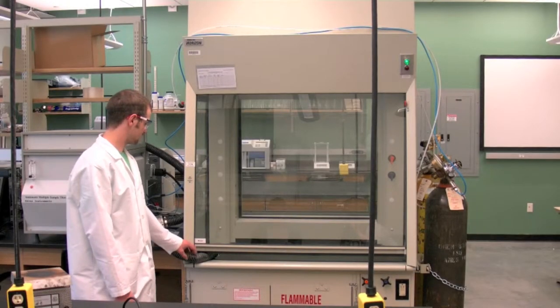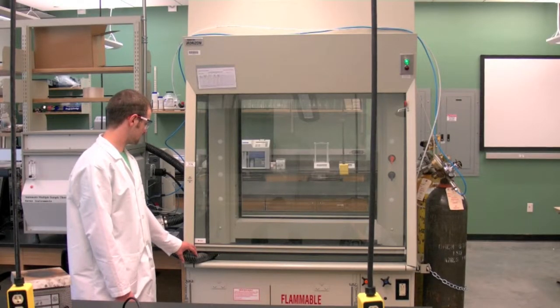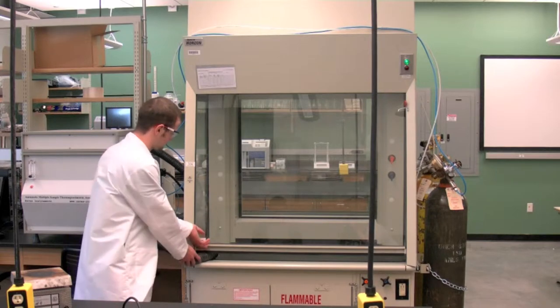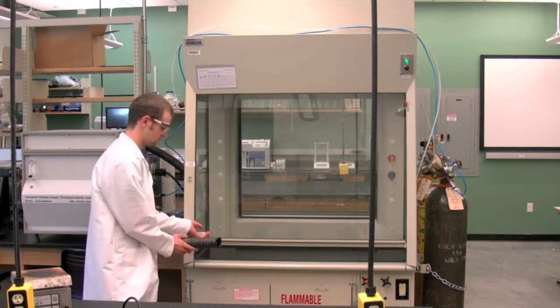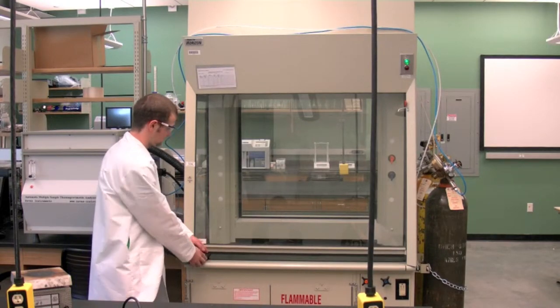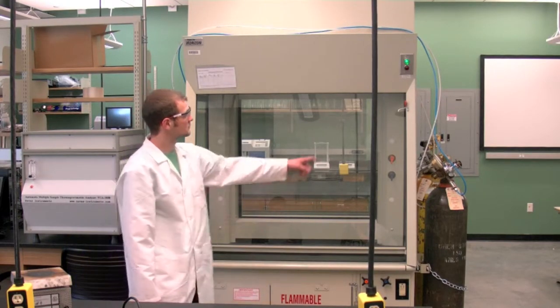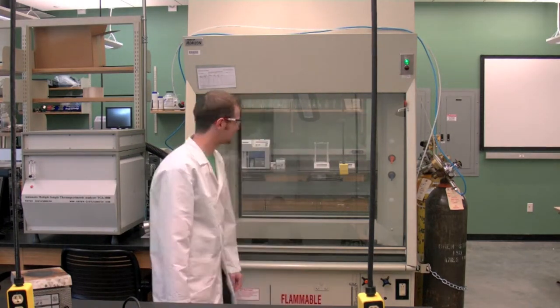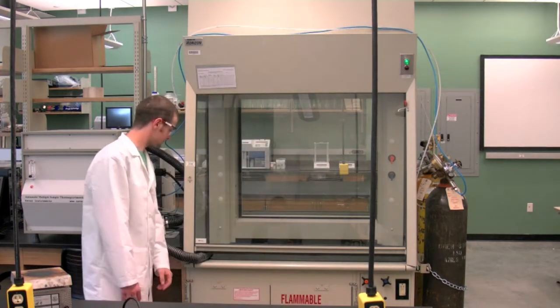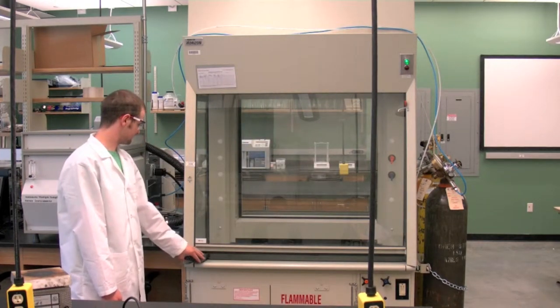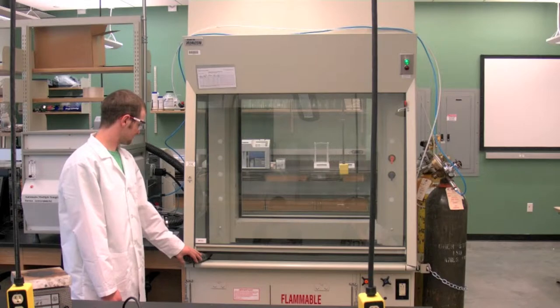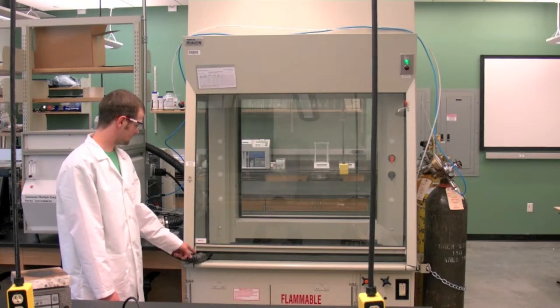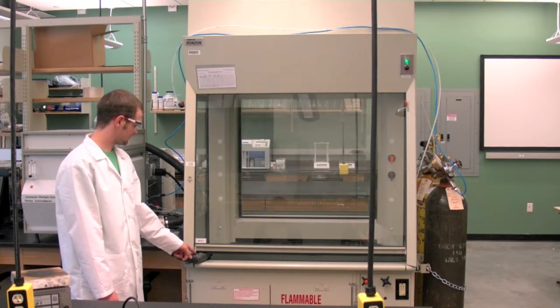Now let's make sure the fume hood is functioning as indicated by a green light on the upper right of the hood. Next, the vent tubing outlet is venting into the fume hood and is held in place by the fume hood sash.